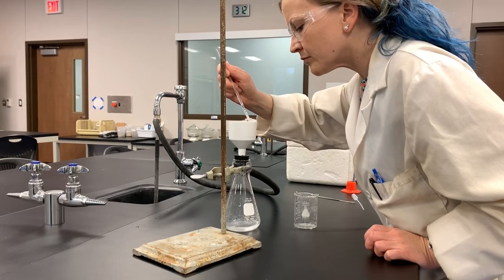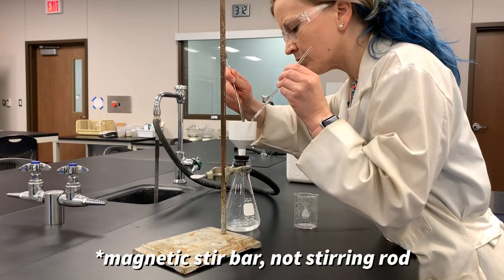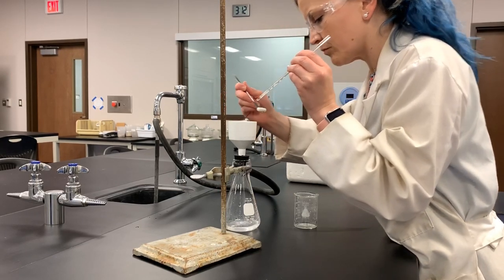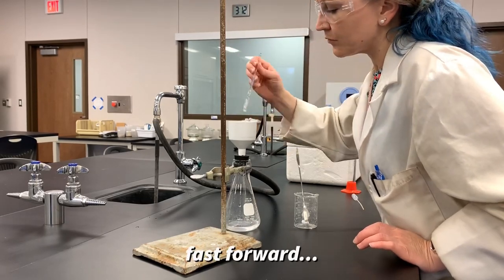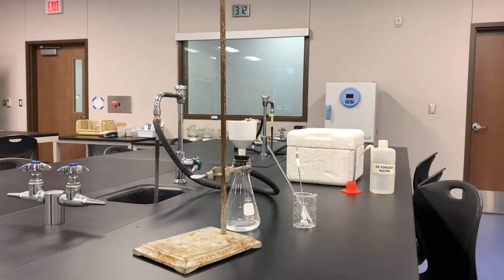At this point I'm removing the stirring rod from the Buchner funnel. I was able to get all of the soap particles off of it — none of the soap pieces were on the magnetic stir bar. I'm moving around the solid in there to try and get the airflow from the vacuum to impact different areas of the solid in the Buchner funnel. While I'm waiting for this to dry, I'm preparing for my next steps in the experiment — I like to be efficient.